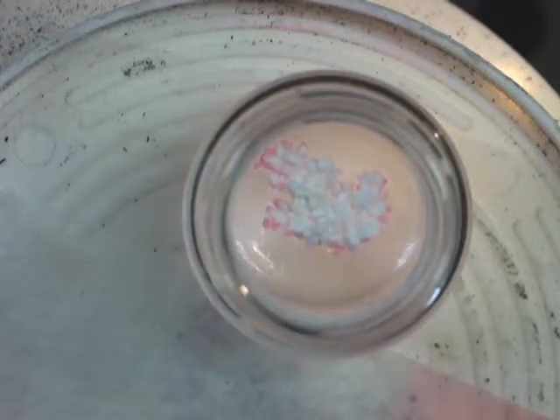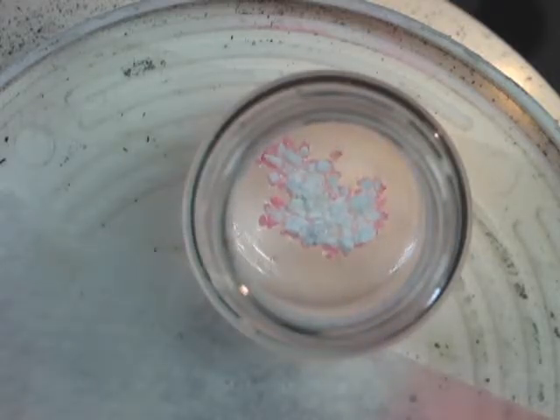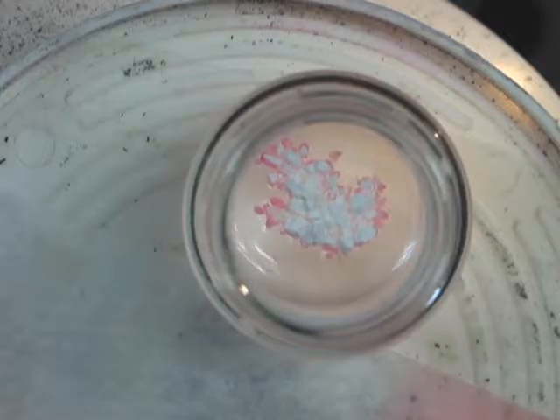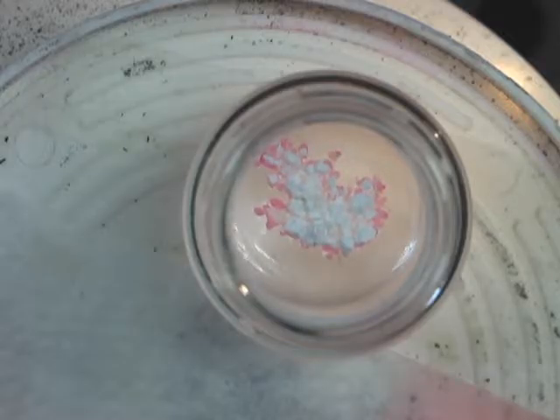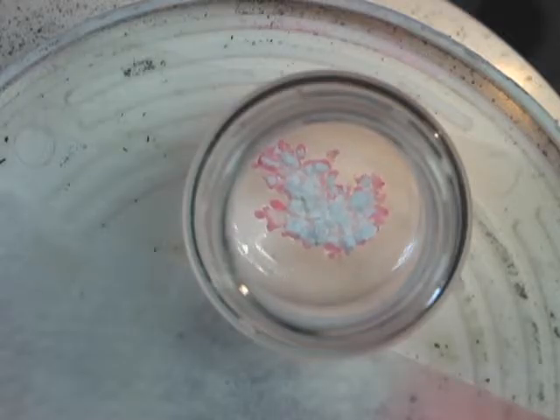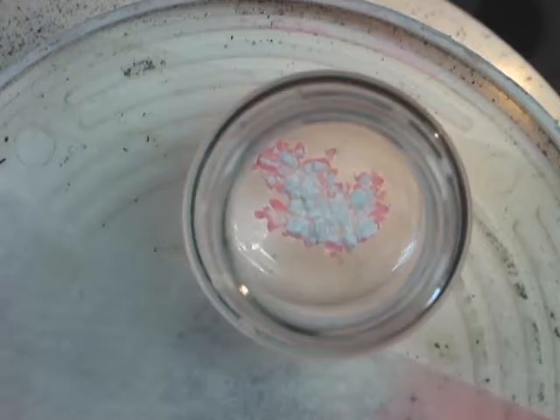We now add our nanomaterial, which is white. Immediately, you can start to see the change of color as our nanomaterial absorbs the oil.